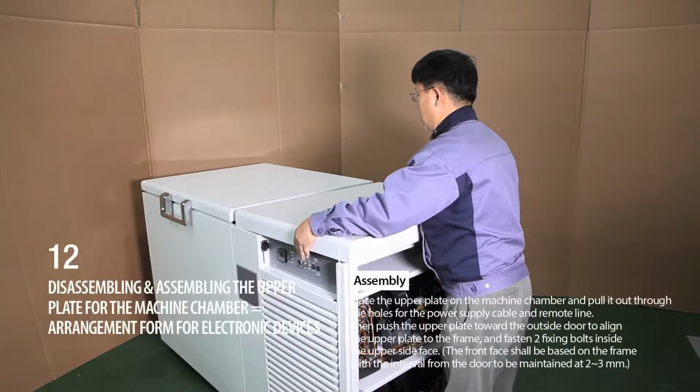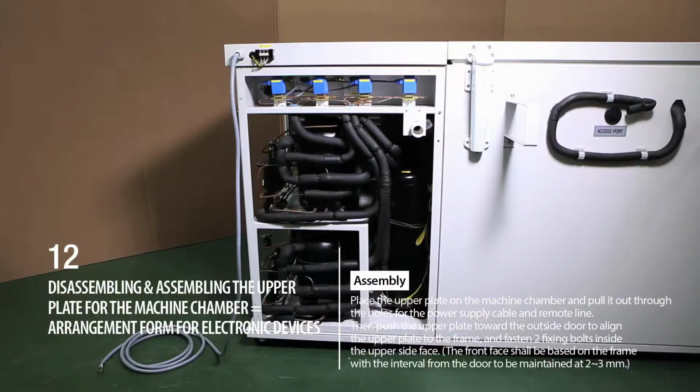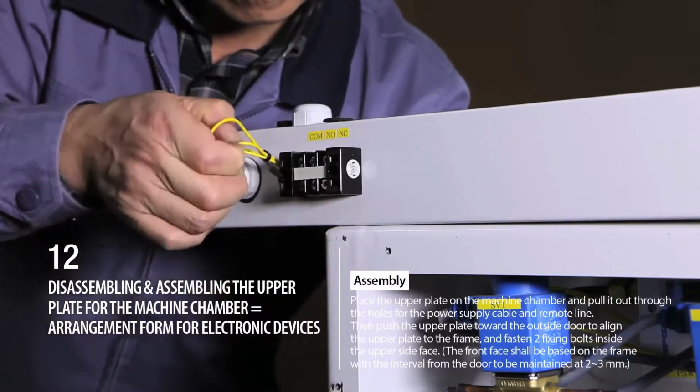Assembly. Place the upper plate on the machine chamber and pull it out through the holes for the power supply cable and remote line. Then push the upper plate toward the outside door to align the upper plate to the frame, and fasten two fixing bolts inside the upper side face.